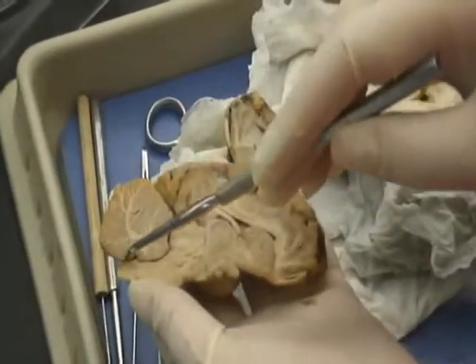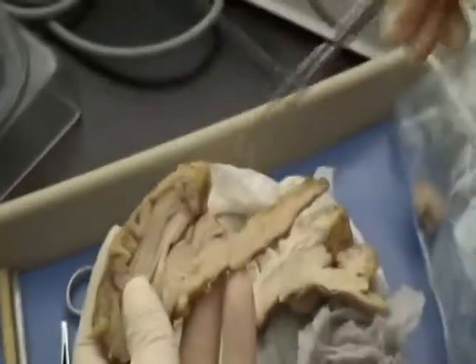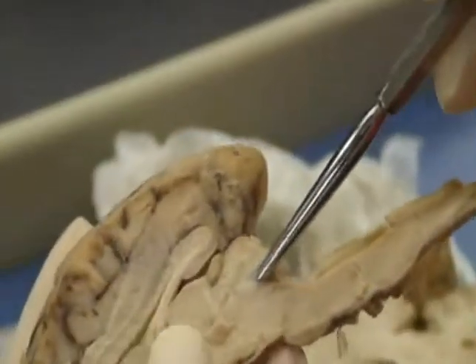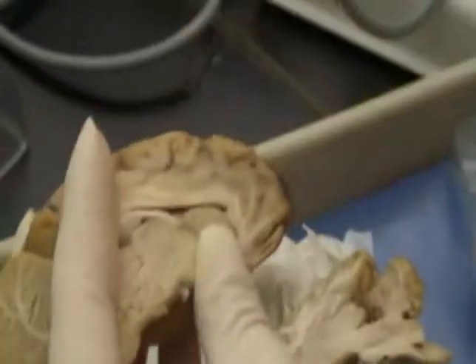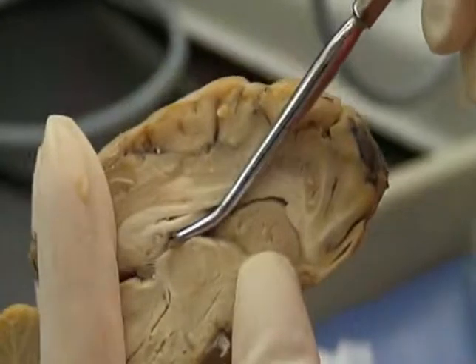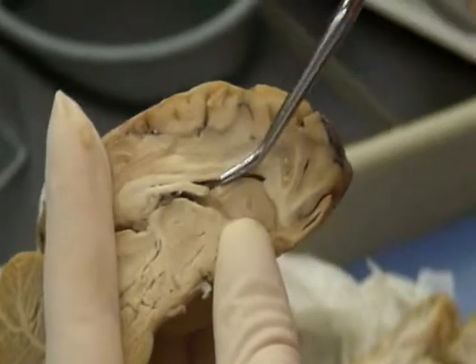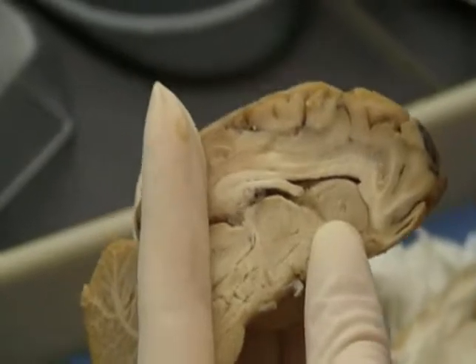The cerebral aqueduct will connect the fourth ventricle to the third ventricle, so it would be on this side better. You can see it starts in here, and I'm poking into it. Okay. The choroid plexus, sometimes I can find some. It's this kind of gray matter sort of stuff that you will see inside the lateral ventricles over the top of the third. That is the choroid plexus, and that makes cerebrospinal fluid. Okay. And again, the prefrontal area. So that's it. Thank you.